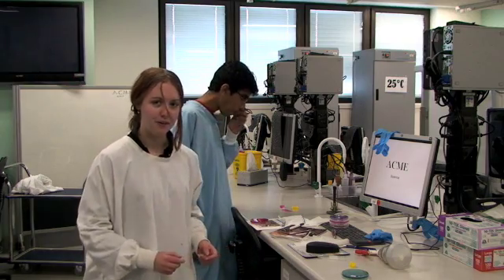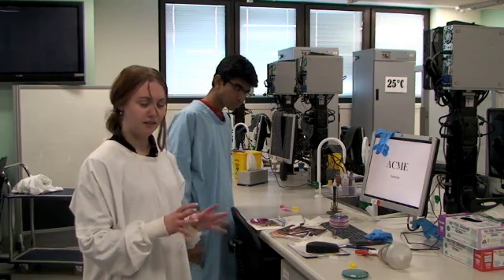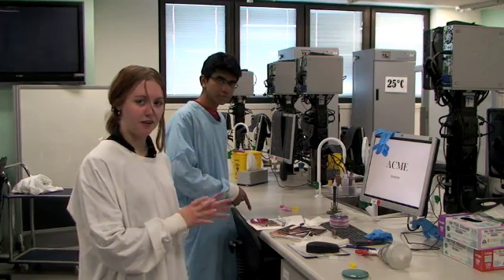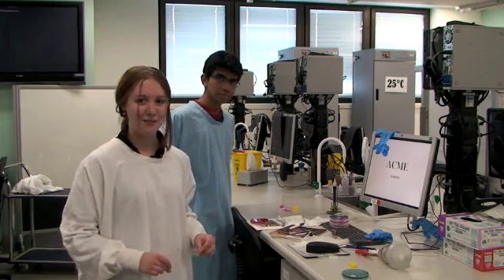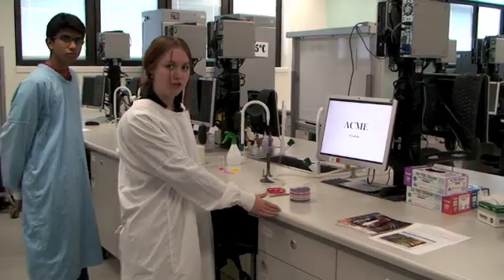When working in the microbiology lab, your bench should be divided up into two areas. One, a clean, dry area for you to take your notes, and a separate contaminated area for cultures. Let's clean this mess up. Our bench is now separated into two parts. Here is our clean area for taking notes, and over here is where we work with our cultures.